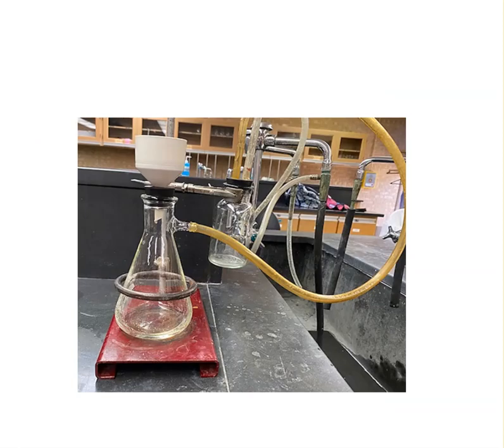Here's what that actually looks like, and the only difference, which is kind of hard to see, is that we do have a trap, and the trap is actually between the flask and the sink, but this is your Buchner funnel.